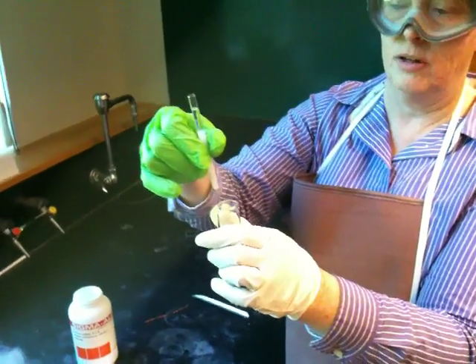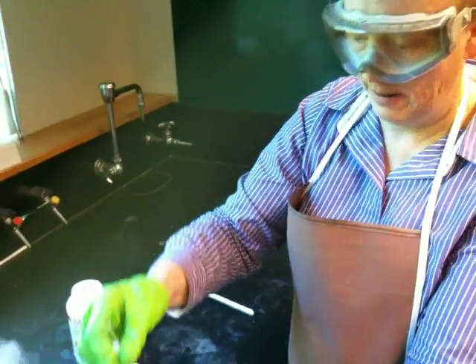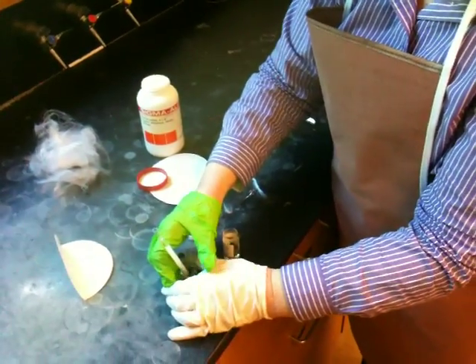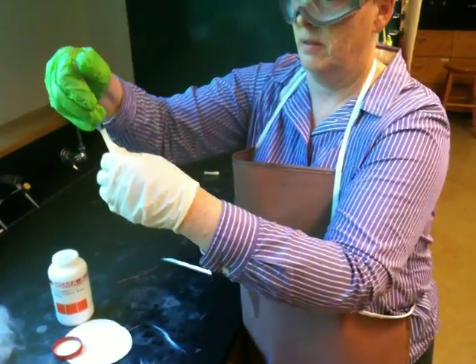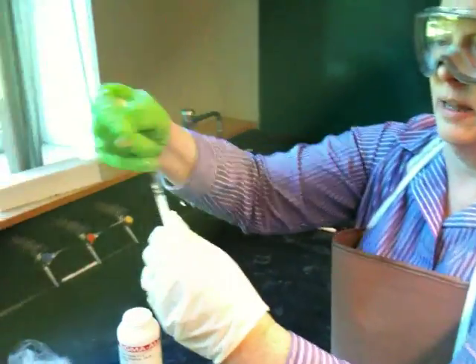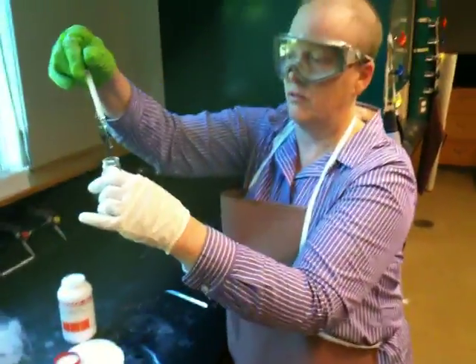Now, what's happening now is really typical. It's really typical for it to get stuck, okay? If it gets stuck, this is a little precarious here. Wow. If it gets stuck, what you do is take your pipette bulb, put it on the top, and put a little pressure on it. You can just put a little pressure on that and it'll start moving. It's starting to drip now, so you can see it's dripping now.